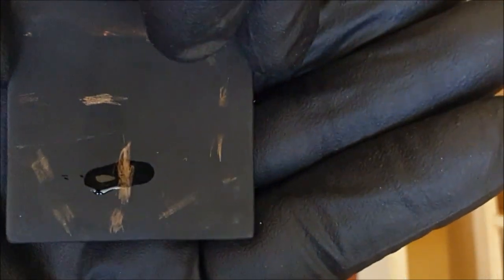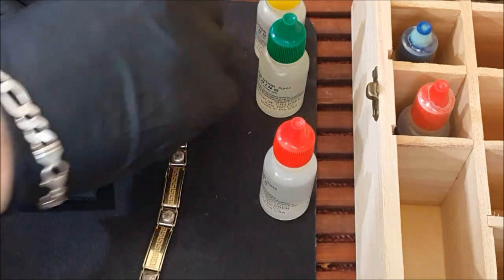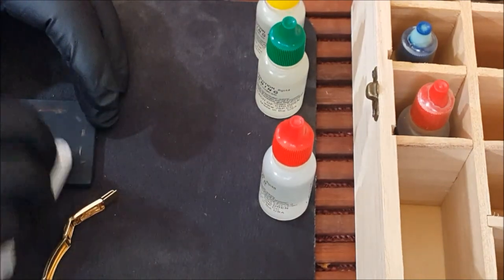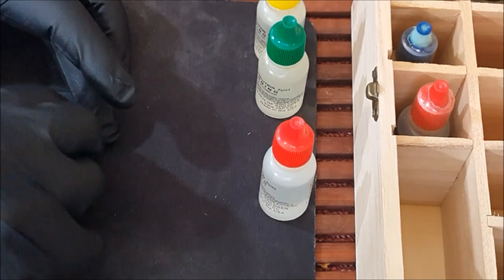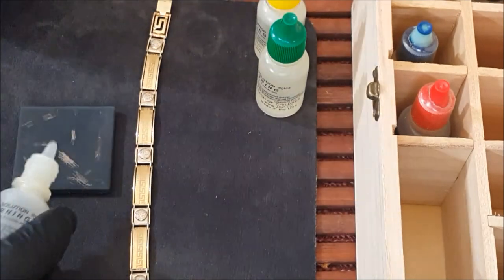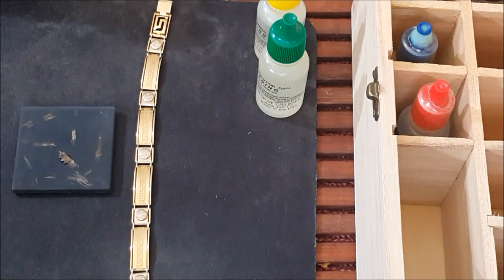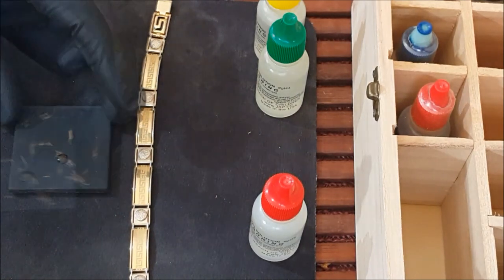This bracelet has passed the 14 karat test. Now we'll try the 22 karat solution — give it 10 to 20 seconds. The 22 karat solution has dissolved the rubbed sample, so there we have it: this bracelet is 14 karat gold.